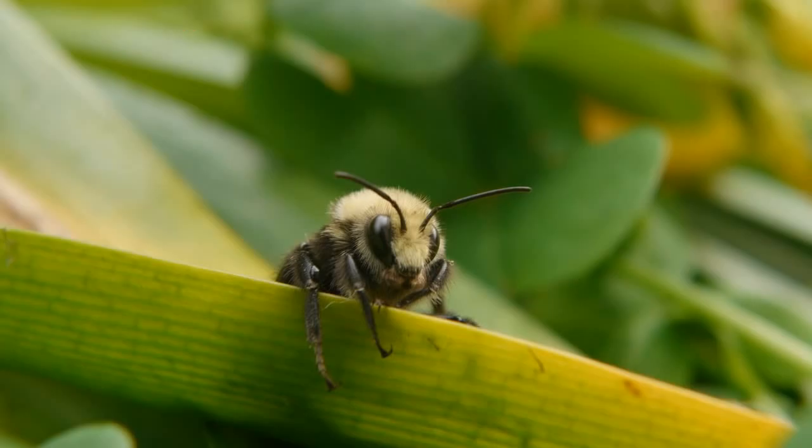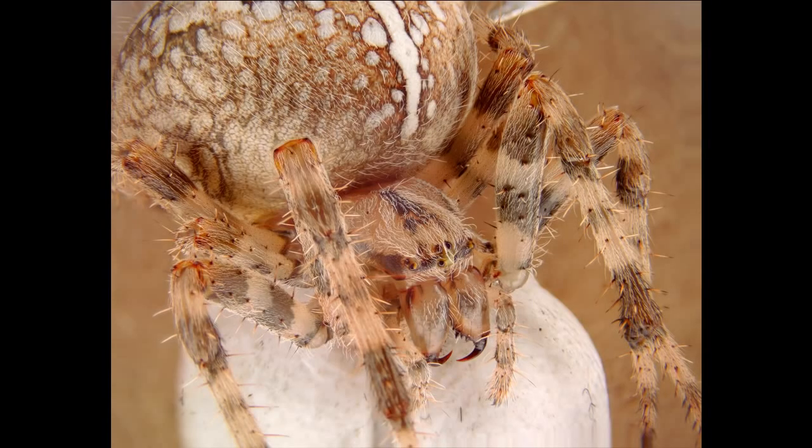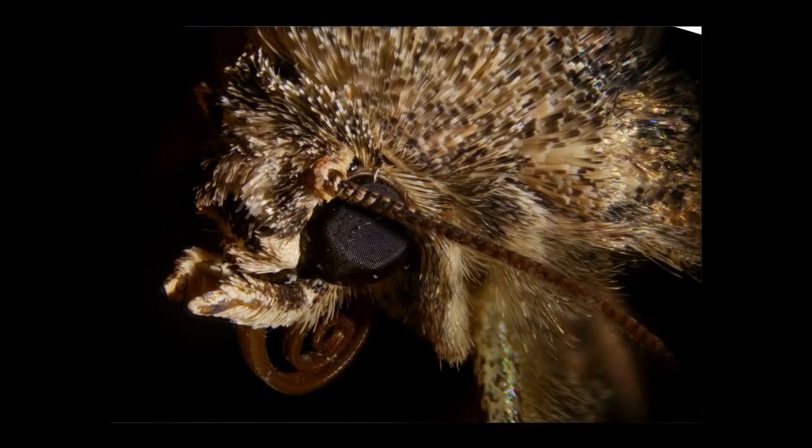Here's some other images that I collected using the same method. One of the problems is that you actually can't get far enough away from the object. So I bought a very low power microscope objective, a 2x objective, and even that's actually too much magnification for a lot of subjects.